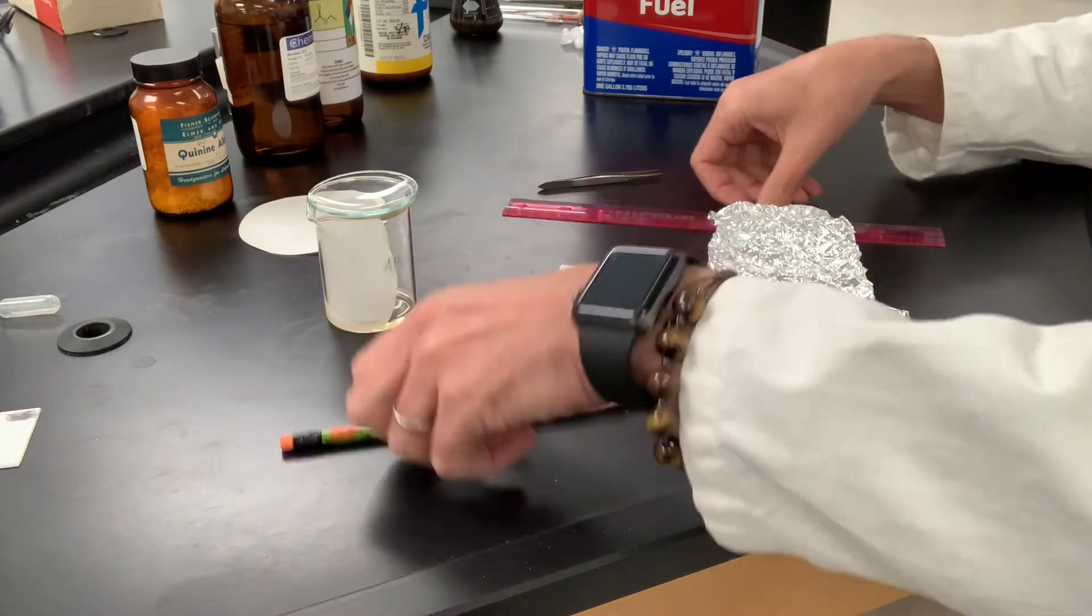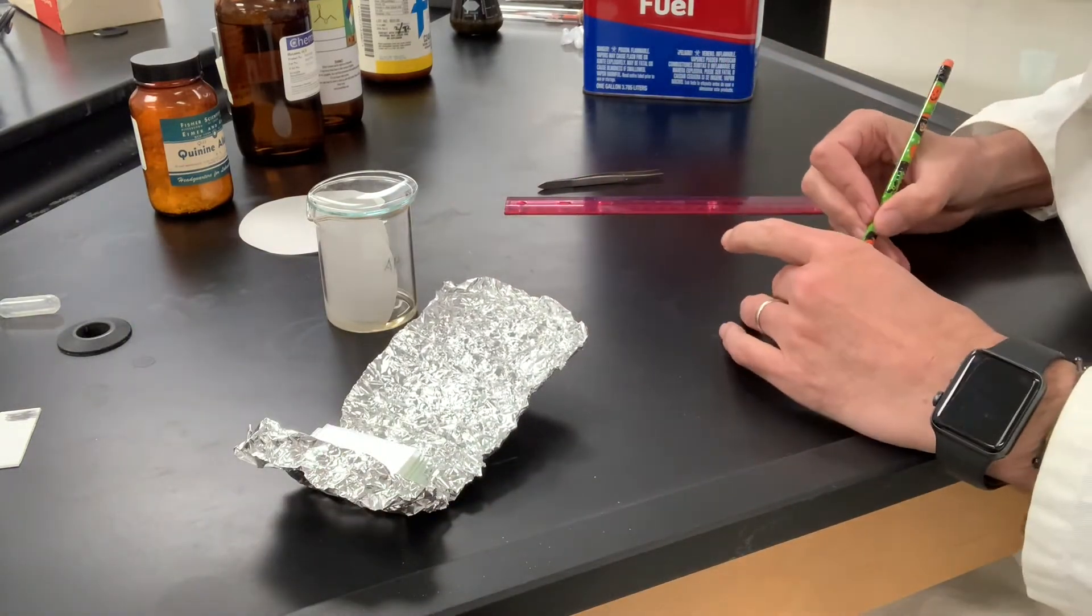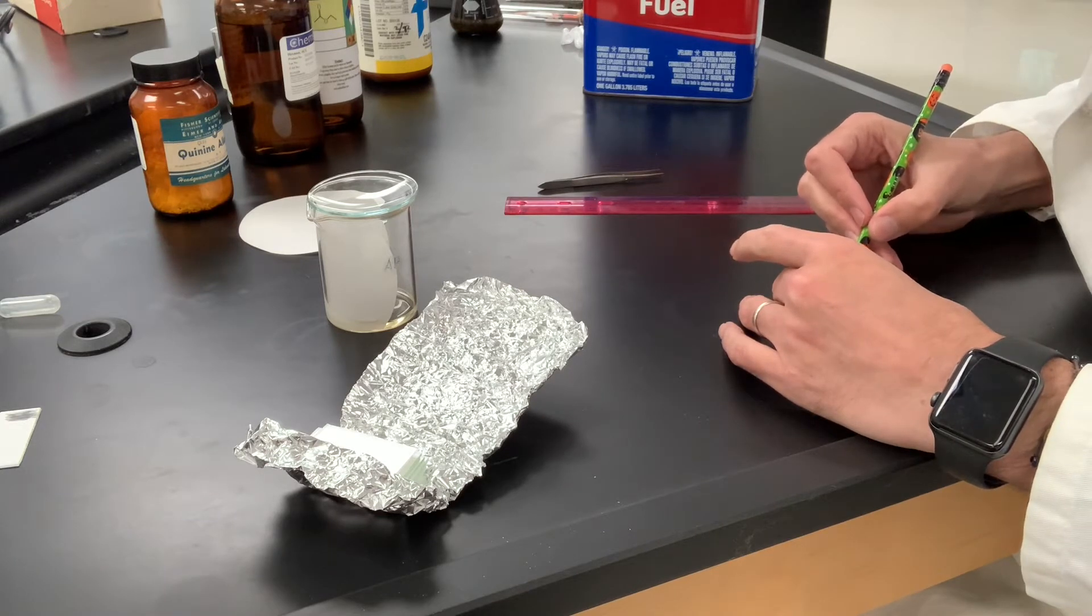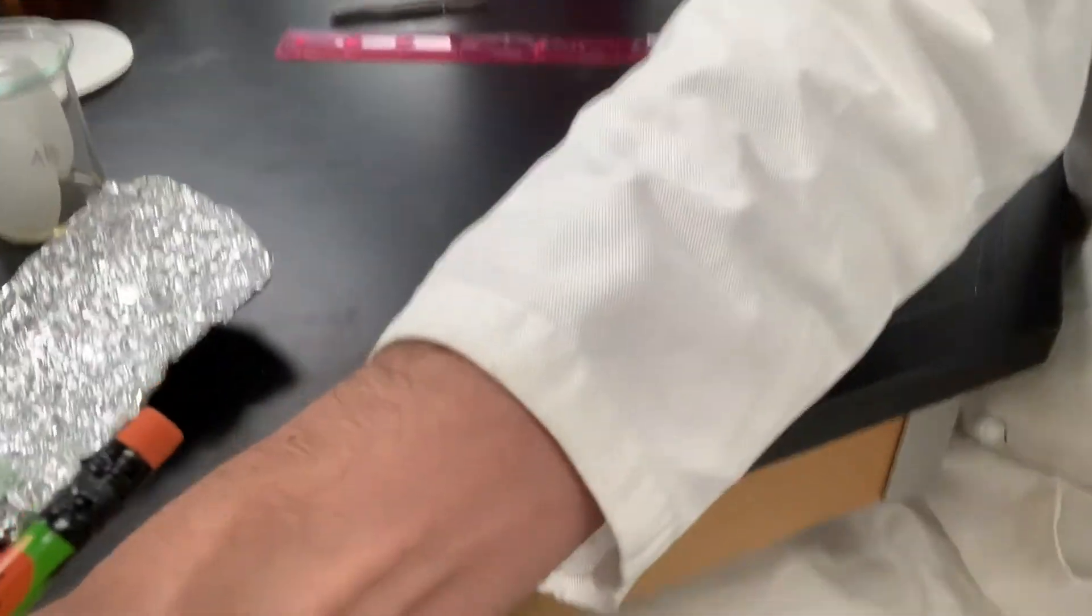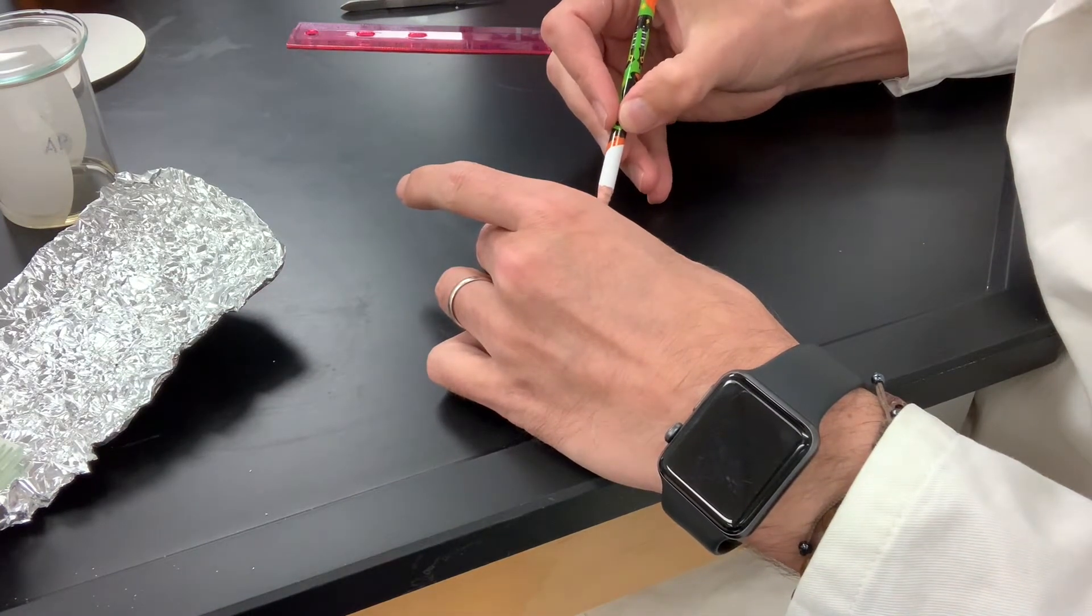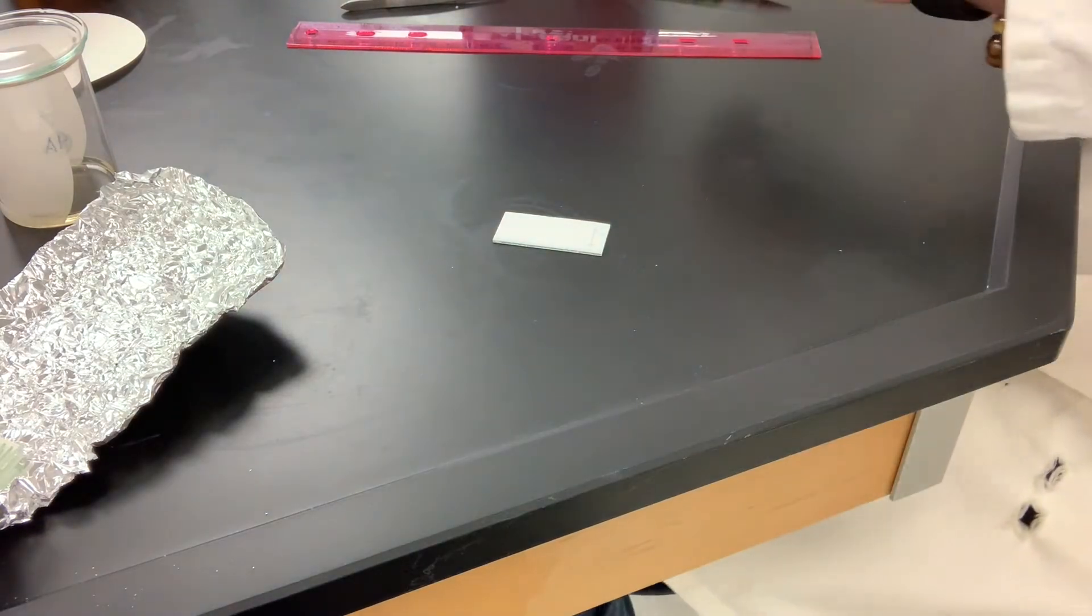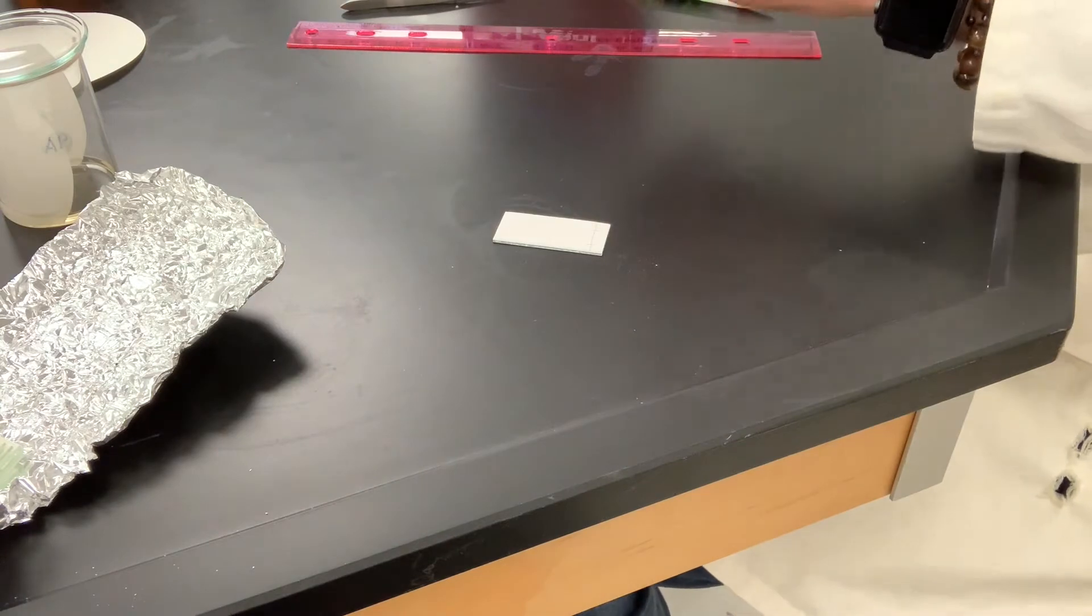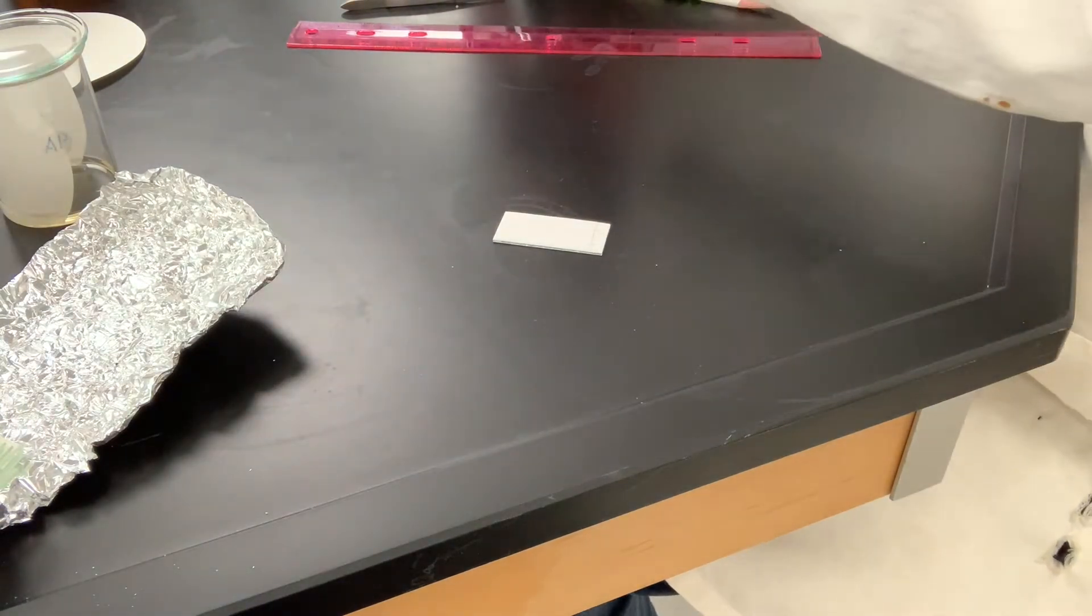So what you want to do is make a little line on the bottom here. And I put three marks on this. I like to use these Eppendorf tubes, and we'll transfer some of our extract in here.